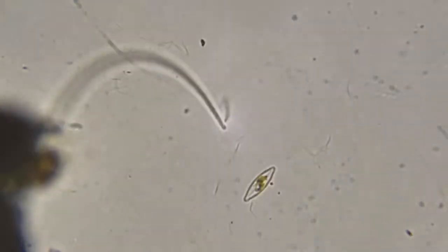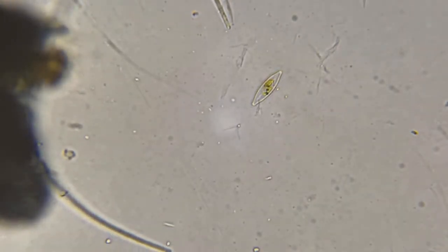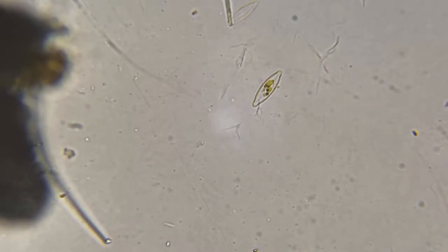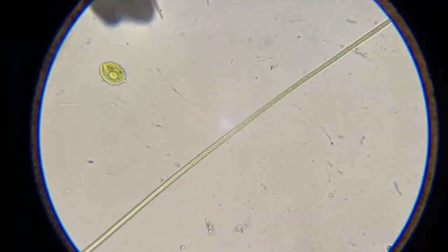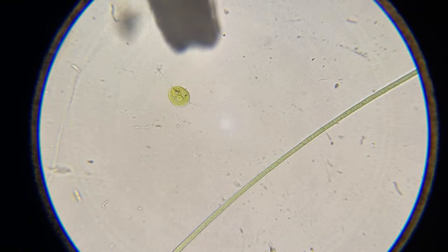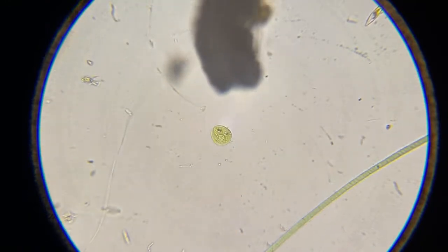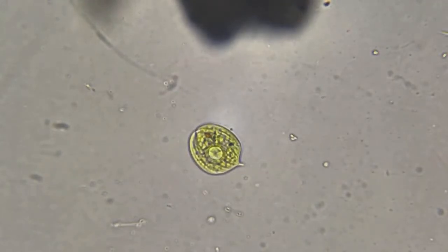So you're looking at something that's very, very small right now. So here's a diatom at 650x. That diatom is very small. It produces oxygen, so it's pretty sweet having a diatom there. This is the Euglena, no digital zoom, so that's 650, no digital zoom. If I digital zoom in on it, you could see the vacuole in there, that's nice.